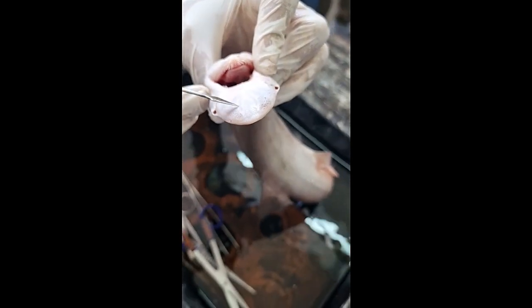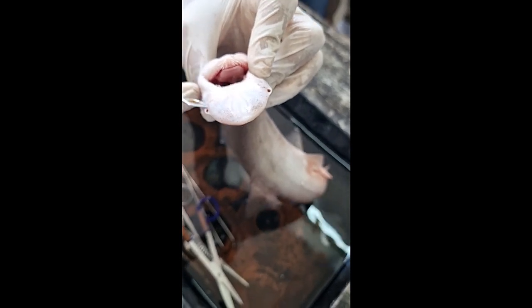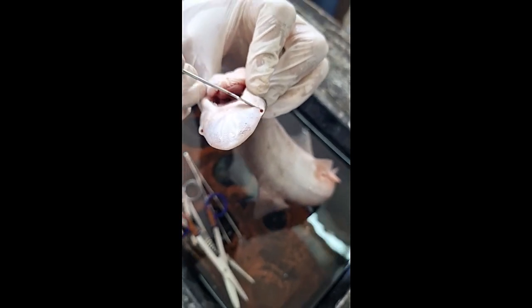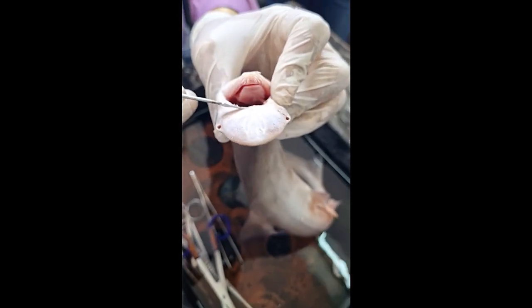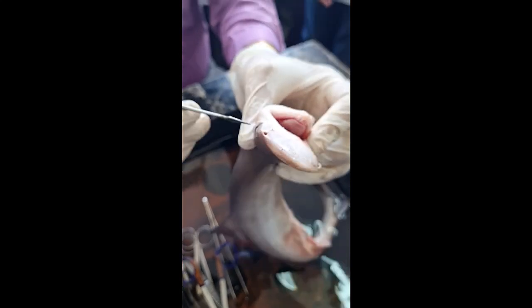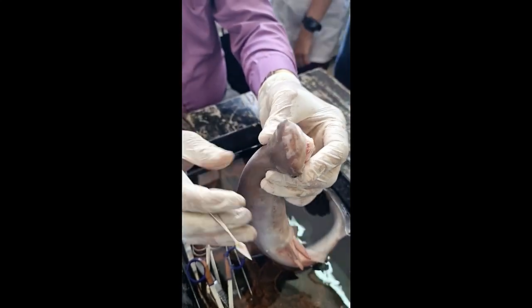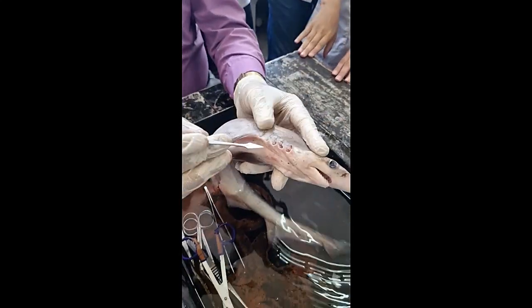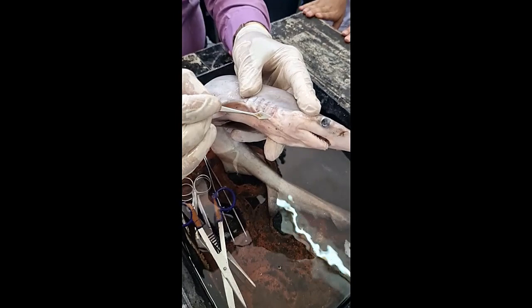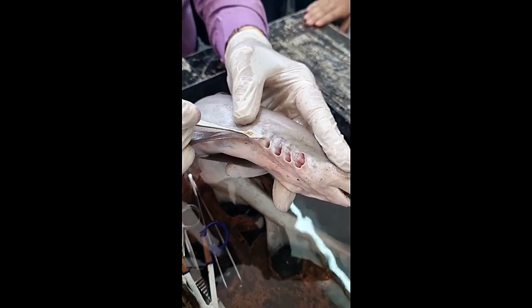You can see cartilage here, nostrils, jaw, lower jaw, upper jaw. This is the eye, and five gill slits — one, two, three, four and five.